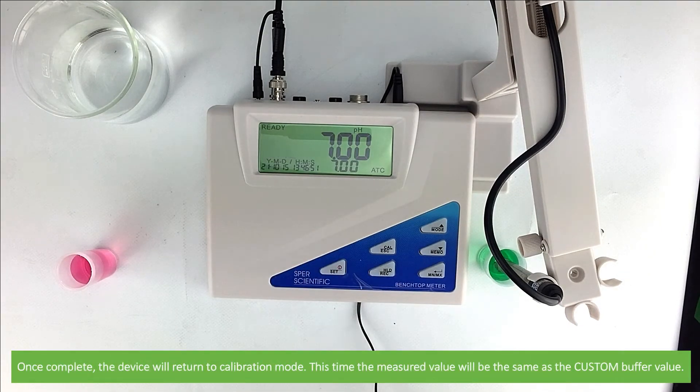Then once complete, the device will return to calibration mode. This time, the measured value will be the same as the custom buffer value.